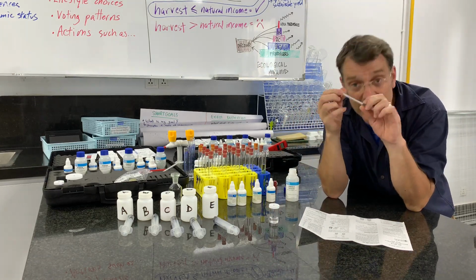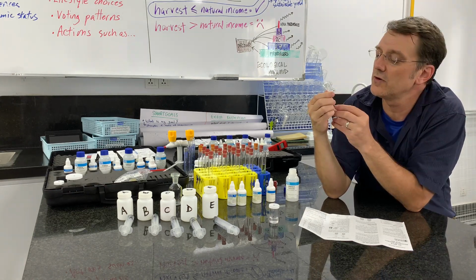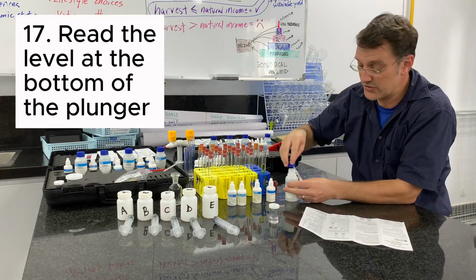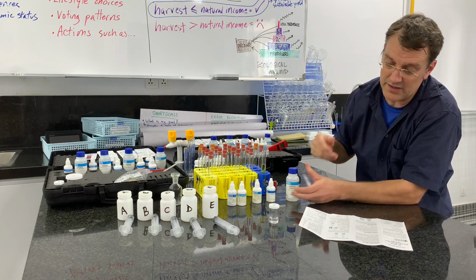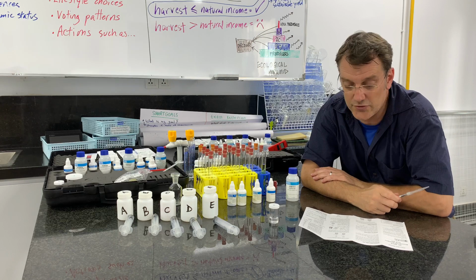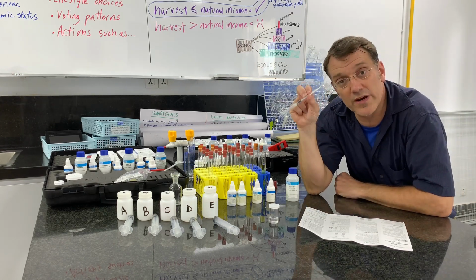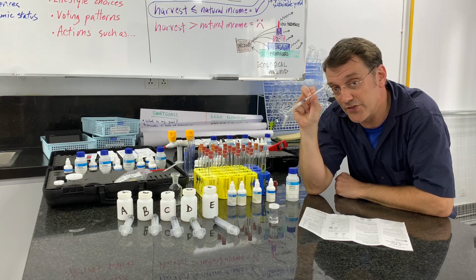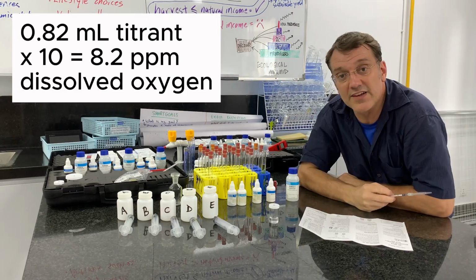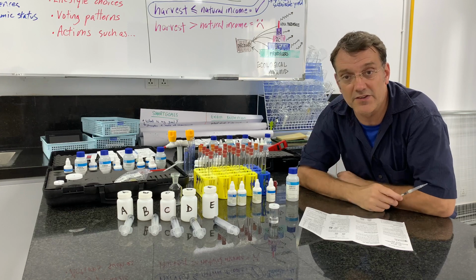Then I'm going to read the results here on my little micro syringe. I'm at 0.82 milliliters of this titrant solution. So 0.82. Read off the milliliters of titration solution from the syringe scale and multiply by 10 to determine your oxygen parts per million. So if 0.82 milliliters is the indicator here on my syringe, that means this sample contains 8.2 parts per million of dissolved oxygen. Now I've completed my dissolved oxygen test.